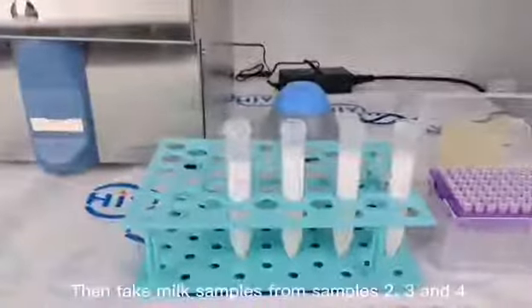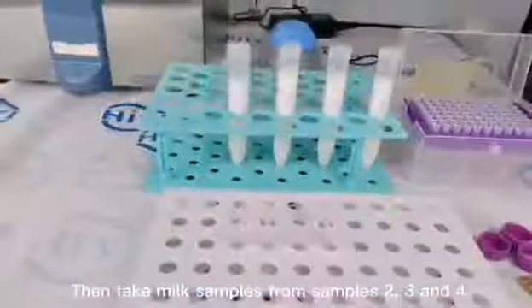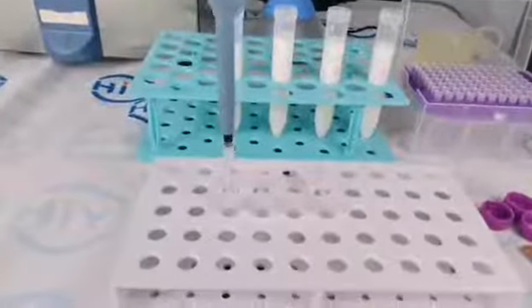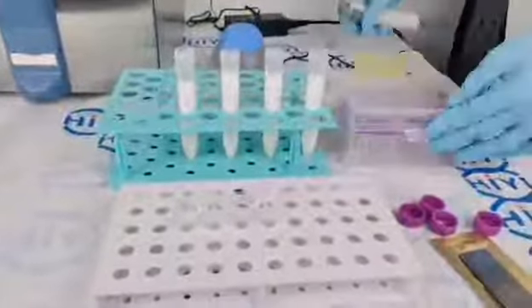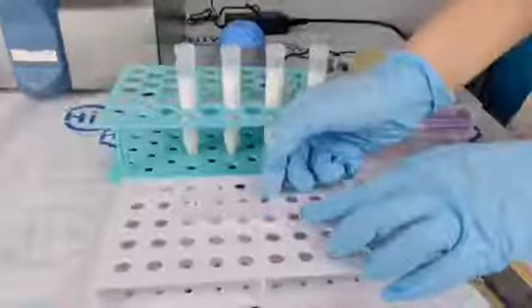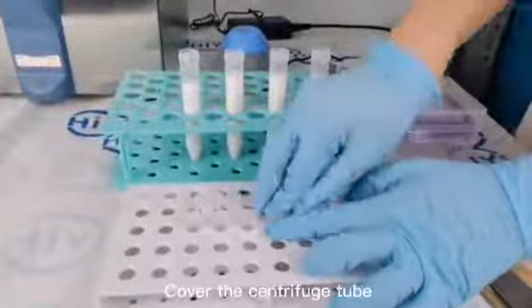Then take milk samples from samples two, three, and four. Cover the centrifuge tubes.